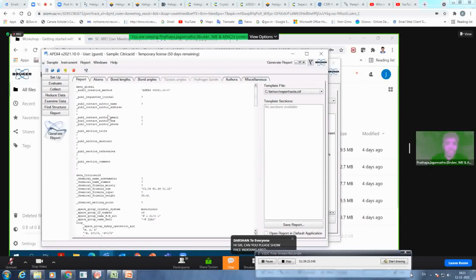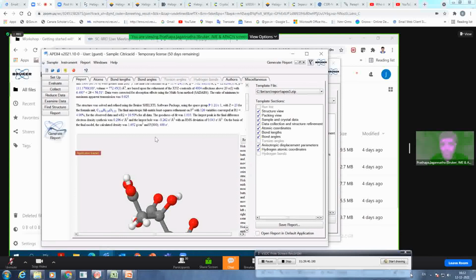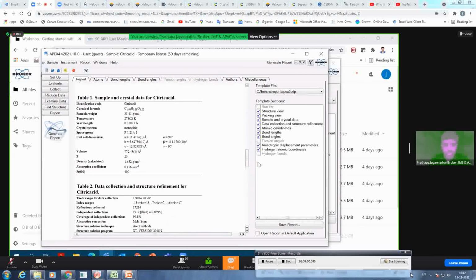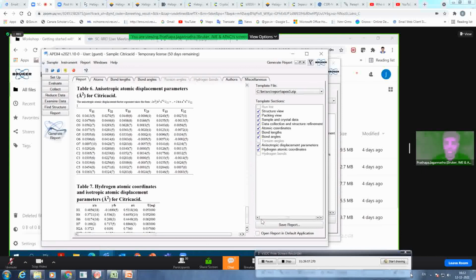Okay, so when you click on report, generally, if it is ActaCIF, it creates a CIF report. If you create apex3.zip or proteum3.zip, it creates a fully informative CIF, which gives you all the crystallographic information: how you collected the data, how you measured the data, what crystal molecule you got, what your packing diagram is, your regular crystallographic table, detailed crystallographic table, coordinates, and so on and so forth. You get all these things, and it will be saved in HTML format. You print that as a PDF and then take it for discussion or for your thesis. That was not there before. So now everything is at your fingertips.